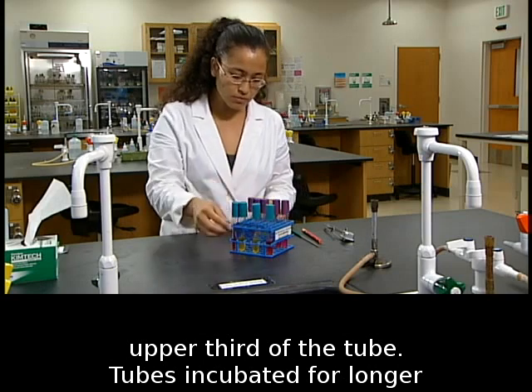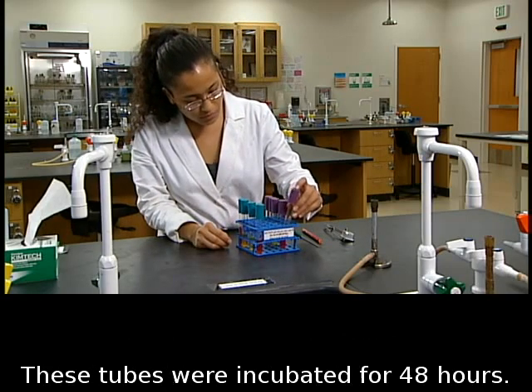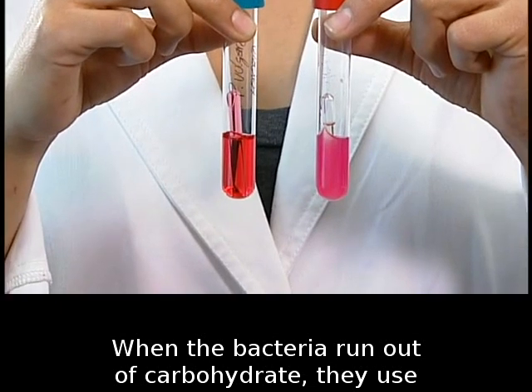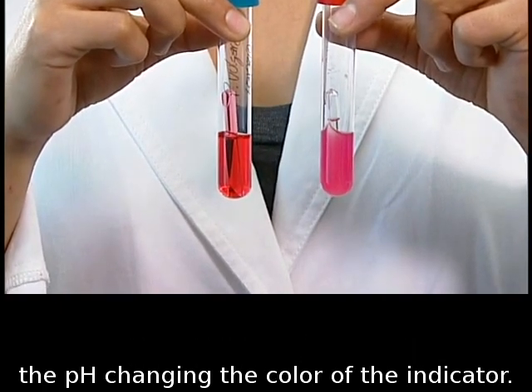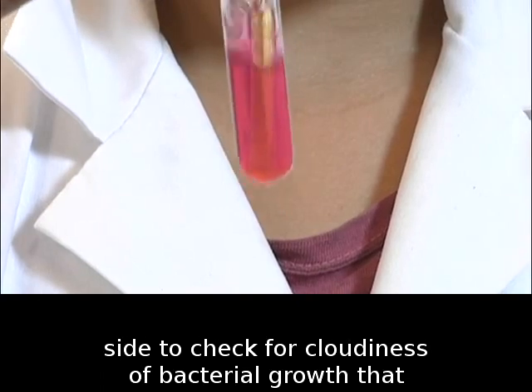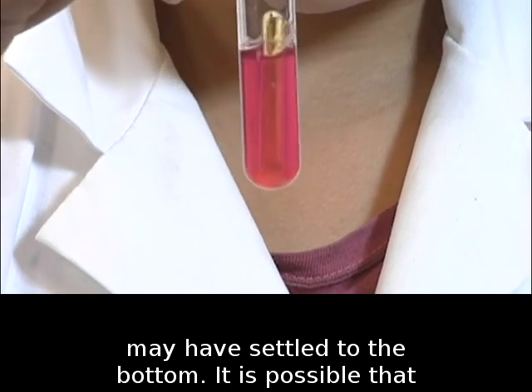Tubes incubated for longer than 24 hours may not give accurate results. These tubes were incubated for 48 hours. When the bacteria run out of carbohydrate, they use peptone, and the resulting ammonium ion increases the pH, changing the color of the indicator. If the tube remains red, gently swirl it from side to side to check for cloudiness of bacterial growth that may have settled to the bottom.